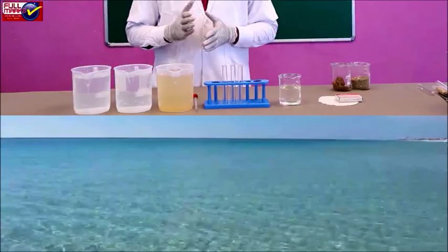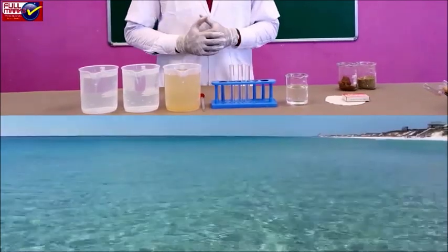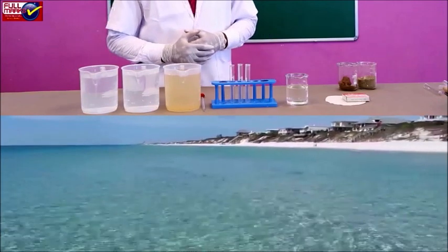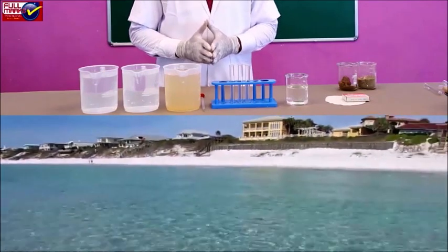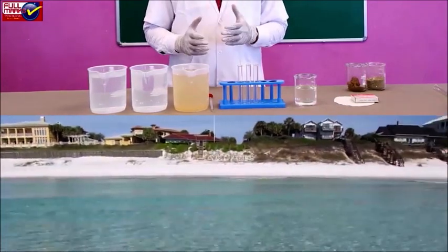Procedure: pure water is neutral, tasteless, odorless and has dissolved nutrients and gases like O2 and CO2. It is not turbid, that is, it is a clear solution. Turbidity of the water body determines the depth up to which light can penetrate and hence affects the distribution and photosynthesis of phytoplanktons and macrophytes.